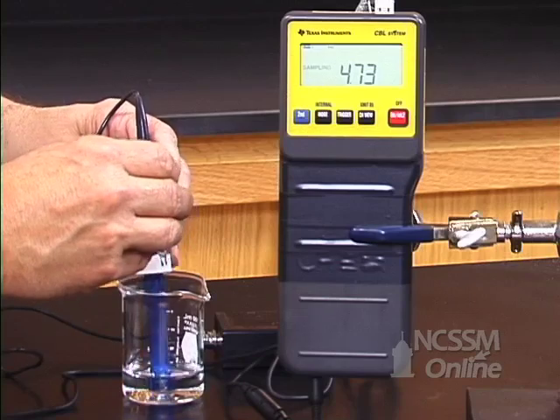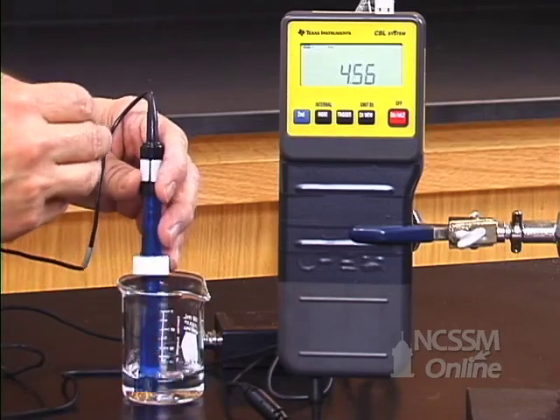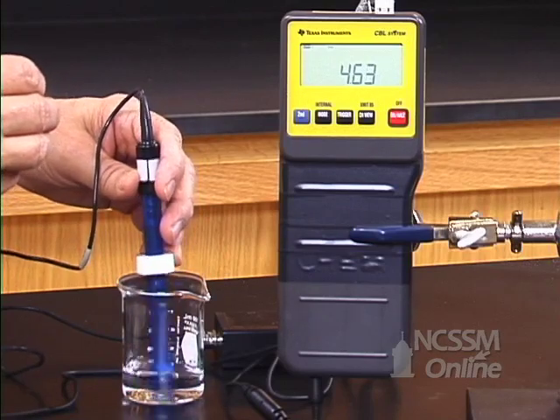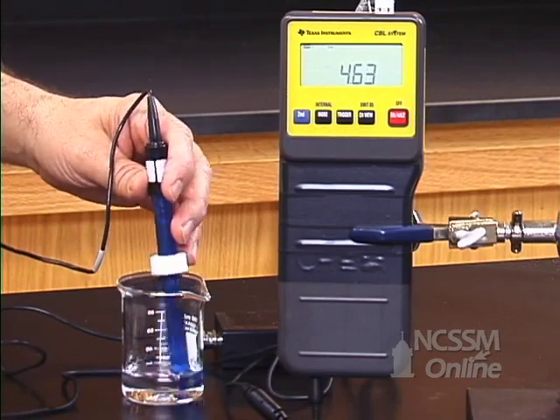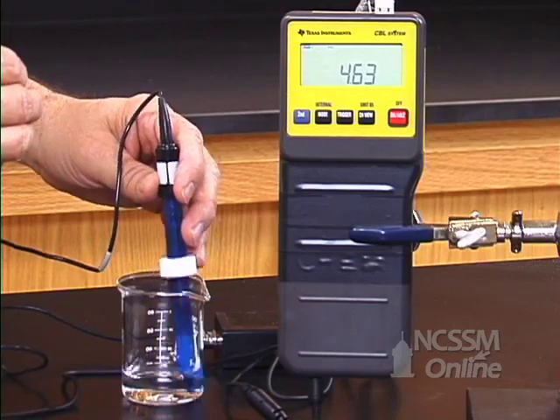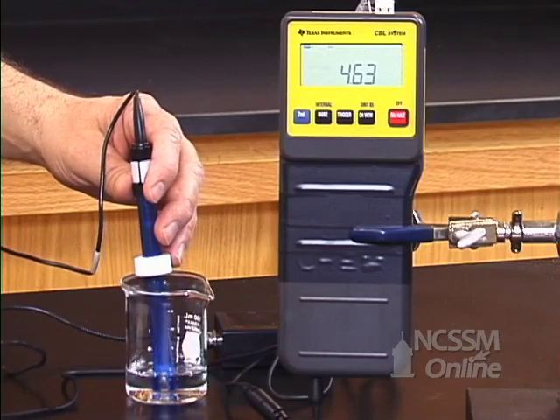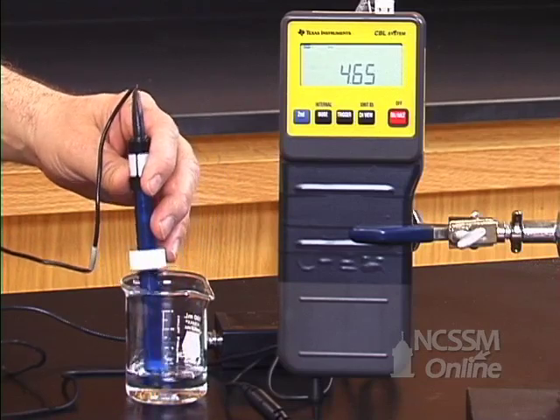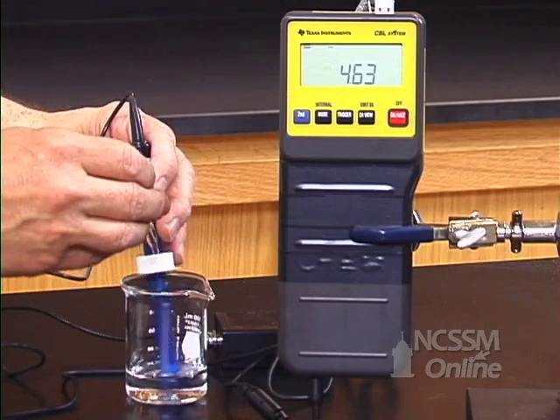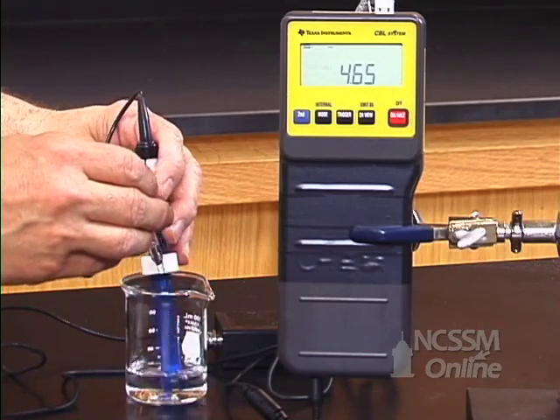I've now added 20 drops of one molar HCl, and the pH is only down to 4.63. Eventually, if I add enough strong acid, I will neutralize all the conjugate base, and I will destroy the buffer, and the pH will drop.